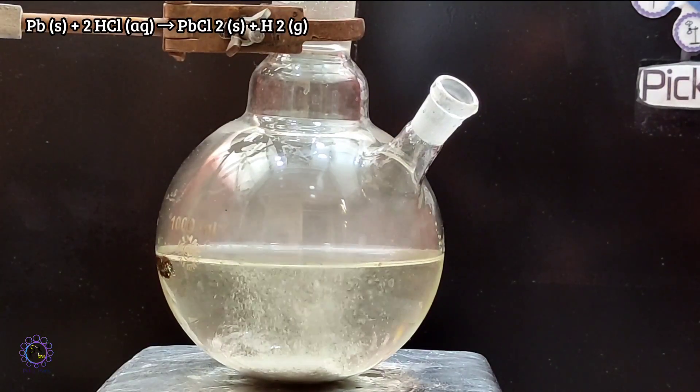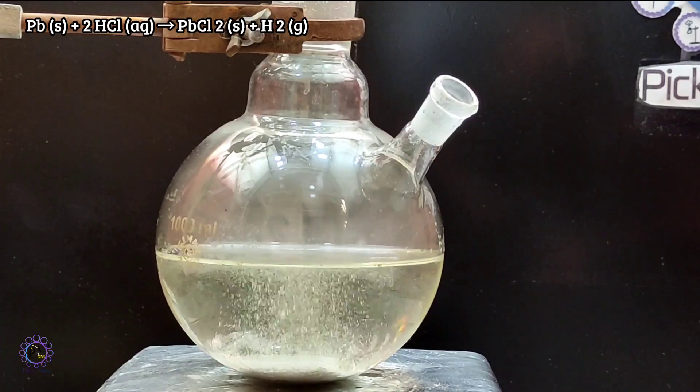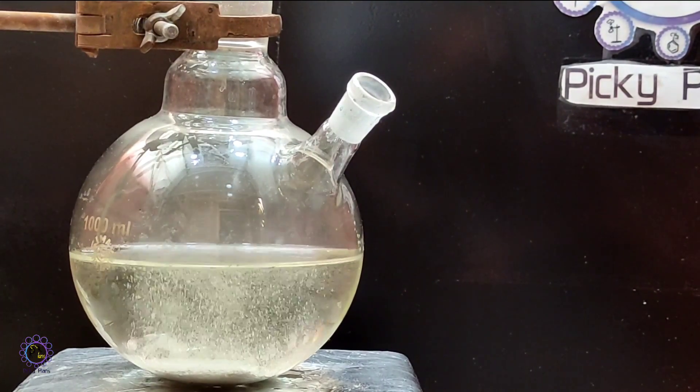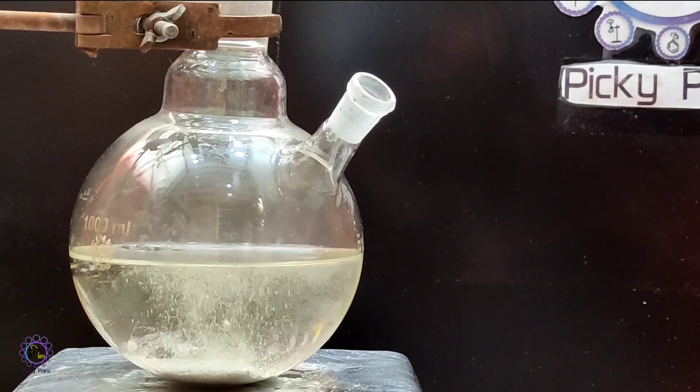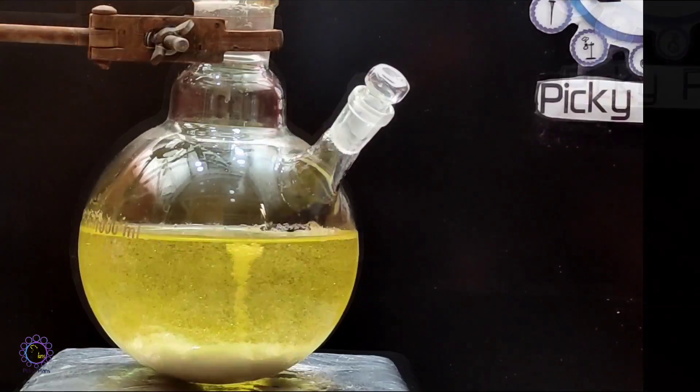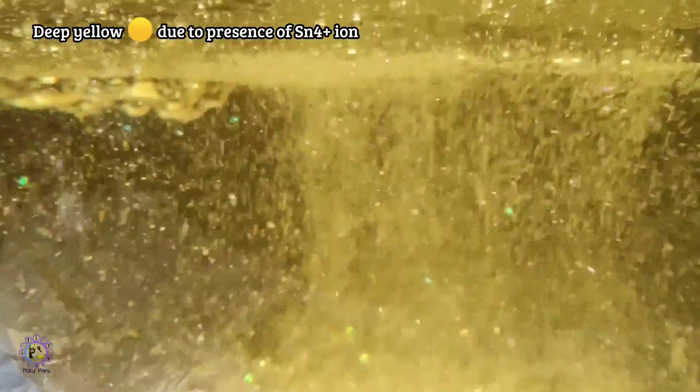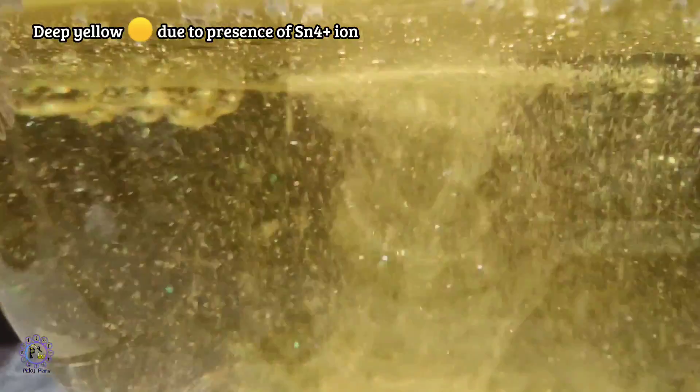As soon as the reaction rate increased, white crystals of lead chloride would precipitate. In order to redissolve this white precipitate, we need some extra hydrochloric acid to be added. At the point that there was no more solder wire to be dissolved in acid, solution turned bold yellow.